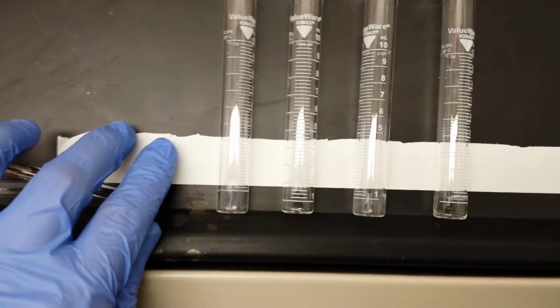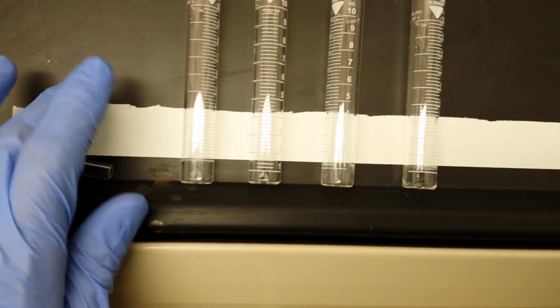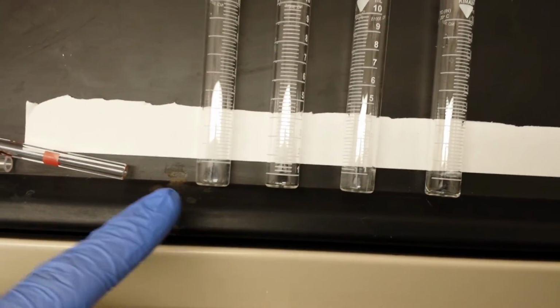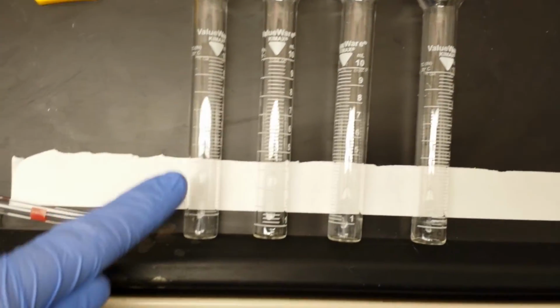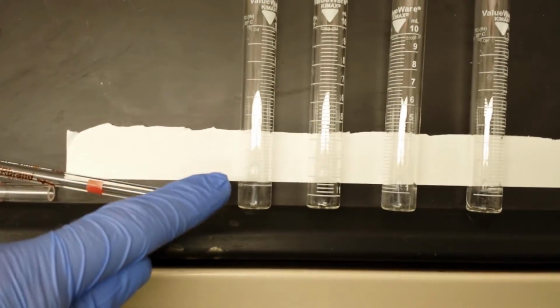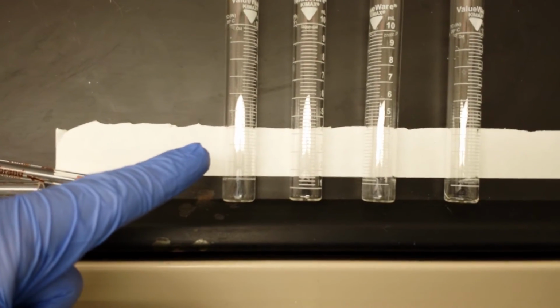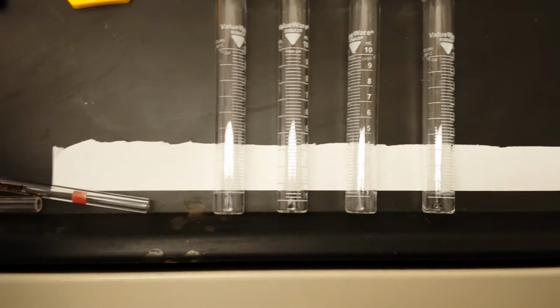Now notice how terrible the range from 1 to 0 is. If I get this piece of paper sitting fairly parallel, you'll notice that I've got a massive distribution of volume that we're calling 1 milliliter. That's going to be present in every one of these. And also notice that it's going to be a variable percentage depending on how full we end up filling this thing. Now that tells you right away, we may have some precision, but we've got no accuracy. So don't trust this as anything other than a very crude guide of how much volume you've got.